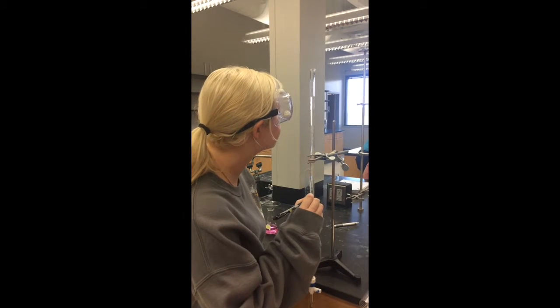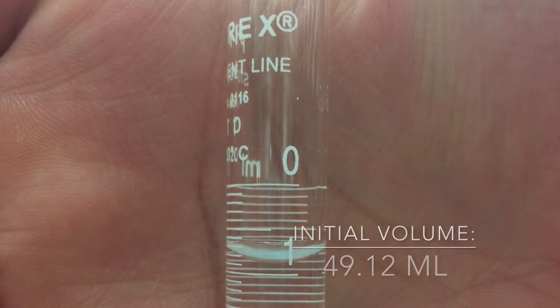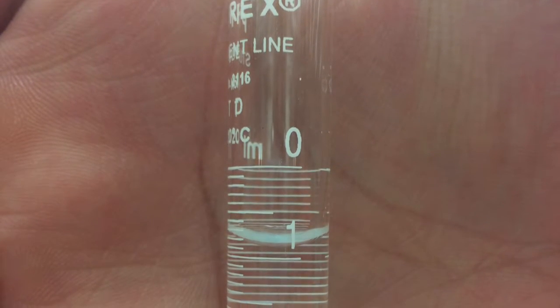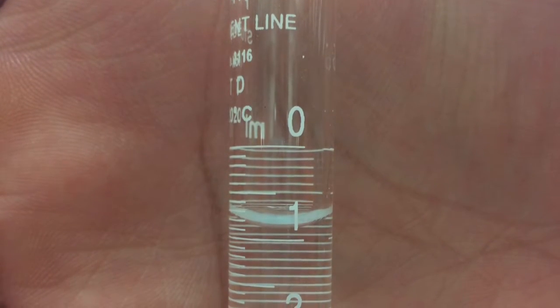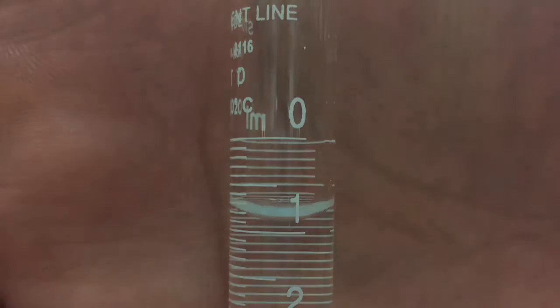First, you should lower the burette to eye level and record the initial volume. Mallory determines the initial volume to be 49.12 milliliters. In order to read a volume in a burette, you must look at the meniscus and note the value to 1 degree of uncertainty, which is 2 decimal places in this case. Then, subtract that value from the total capacity of the burette, which is 50 milliliters.